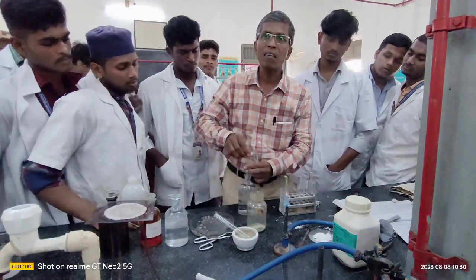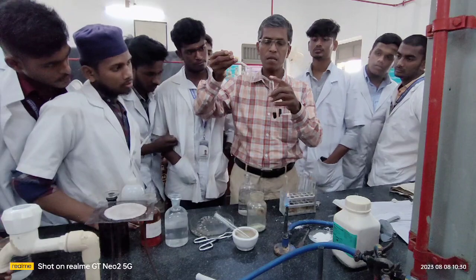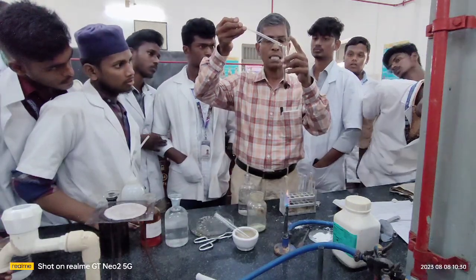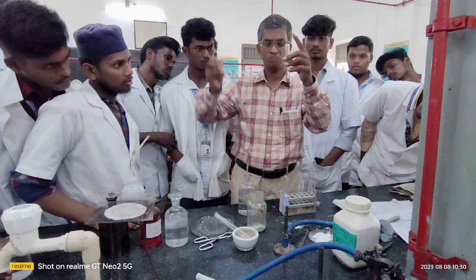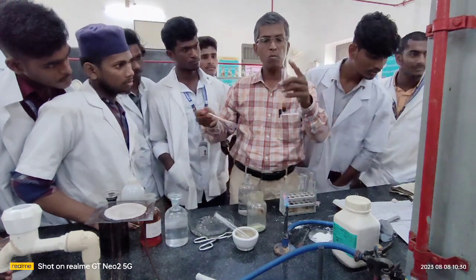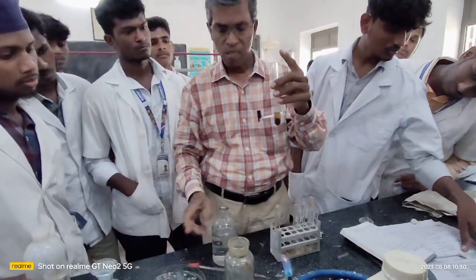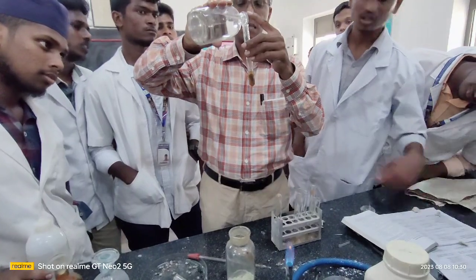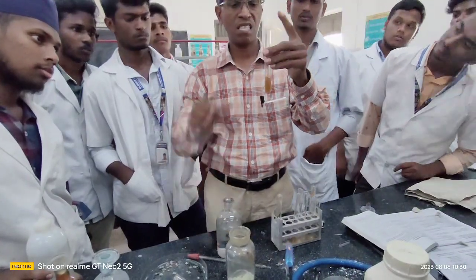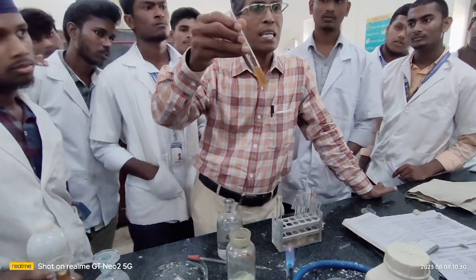Now I am adding a little dilute sulfuric acid from your dropper tube. See the change in color. No blue or no green. Go ahead, a little extra also. No formation of blue color or green color.